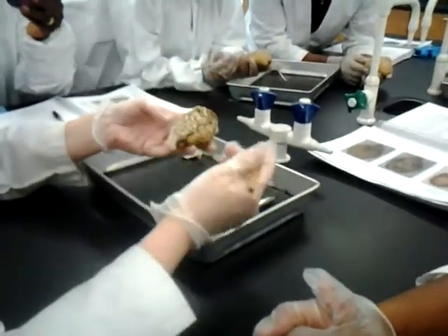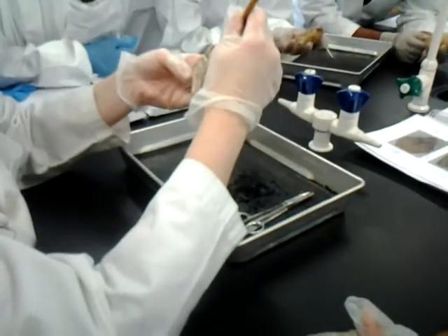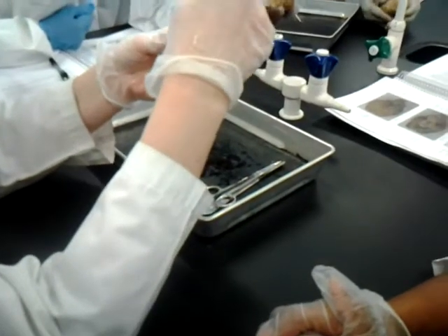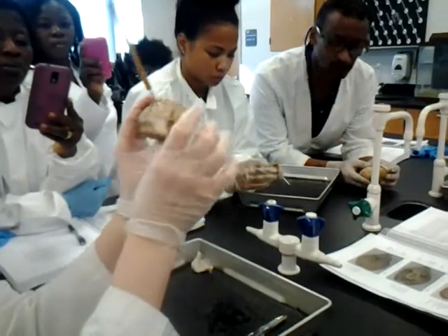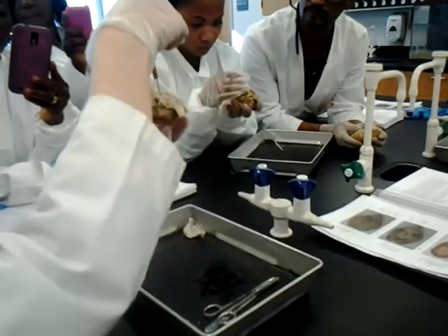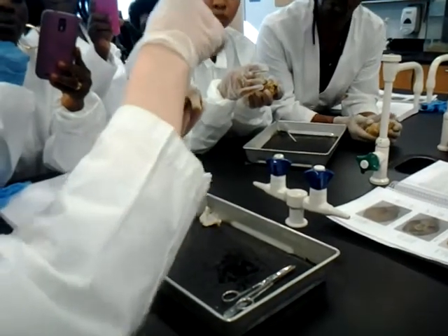If I flip it upside down, let's go over the parts of the brain stem. I'll go right in the top. At the top would be the midbrain, or the most superior, or the most anterior, I should say. And then the bump is the pons.